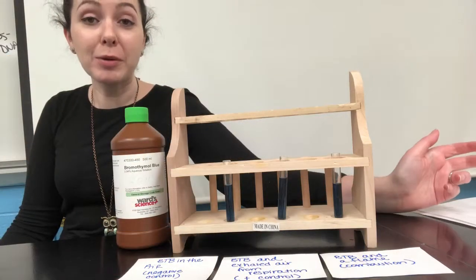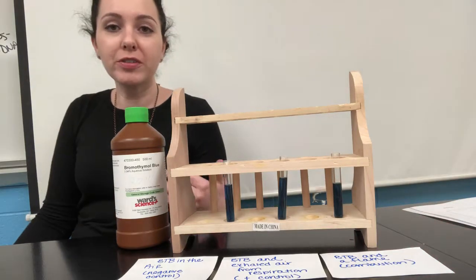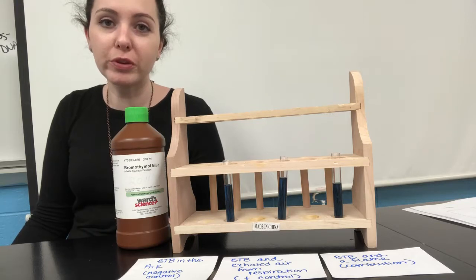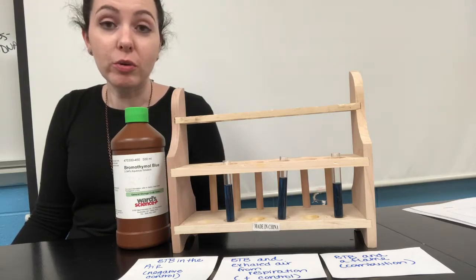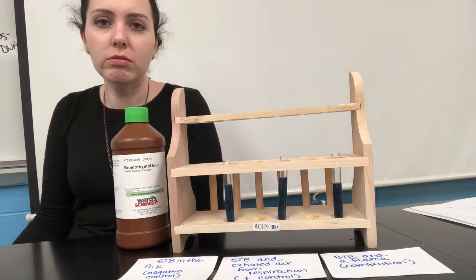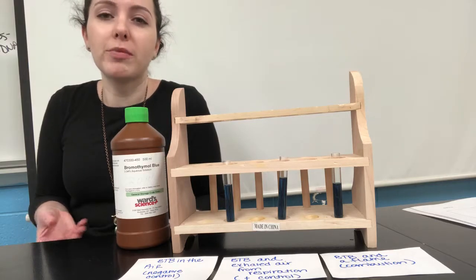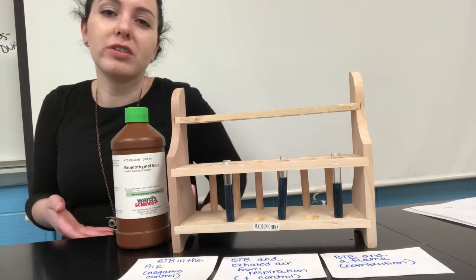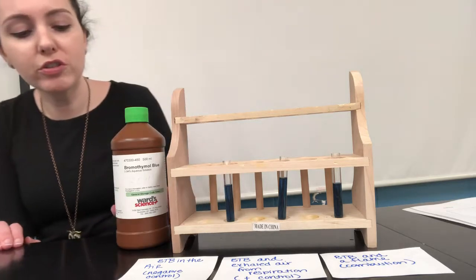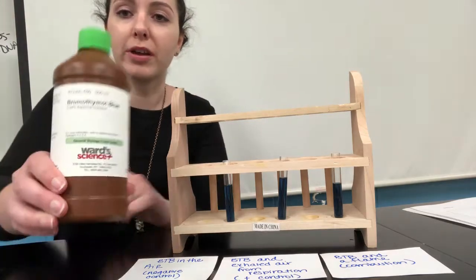And I'm about to show you a really cool lab demonstration. So as part of the algae farm project, the first part of the project, you need to build a device that's going to capture carbon dioxide and bring it over to the algae farm. So how are we going to test for that? Excellent question. How do you know for sure that carbon dioxide is actually moving somewhere or it's actually there? Well, we can use a chemical indicator called BTB or bromothymol blue.